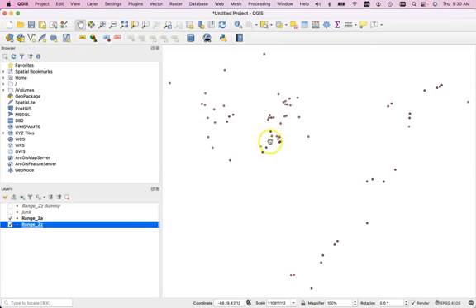So here's what I suggest. I suggest that Dan first make a data set that includes only these points, and makes a second data set that includes only this long group of points over here, and that he runs a SAMOVA just on these points and a SAMOVA just on these points. And actually, before he does that, I would recommend that he in fact use his rarefied data set, which is randomized, and that he say, look, I know that I have at least two distinct subregions. I have a subregion over here of populations, and I have a subregion over here of populations.